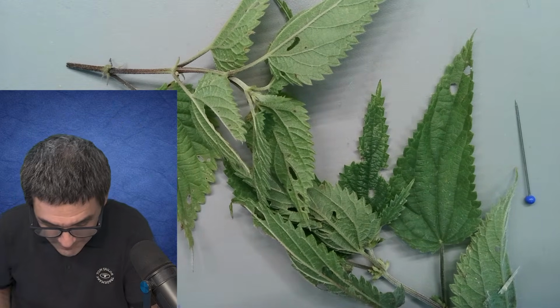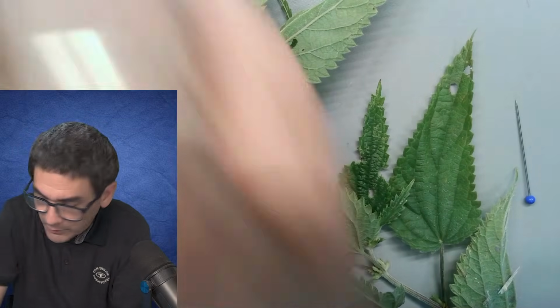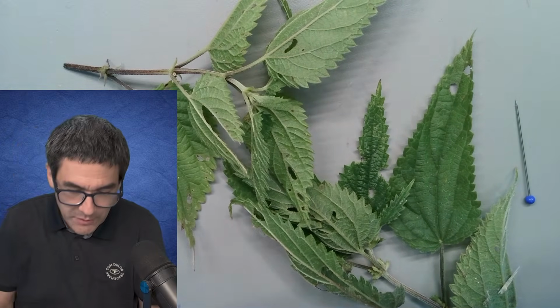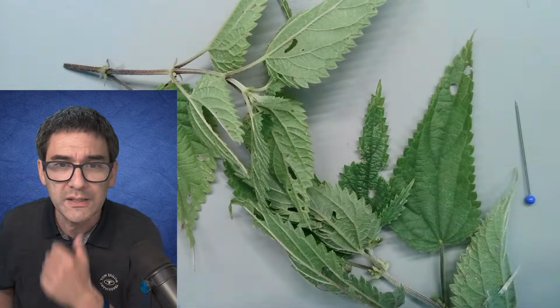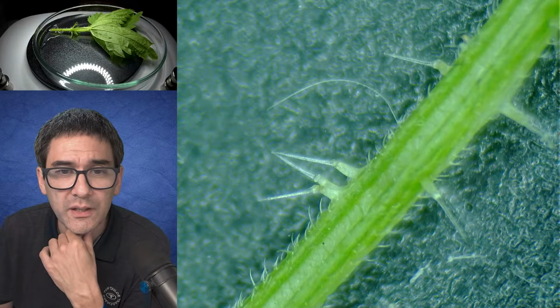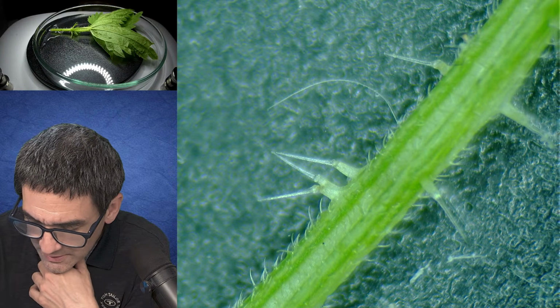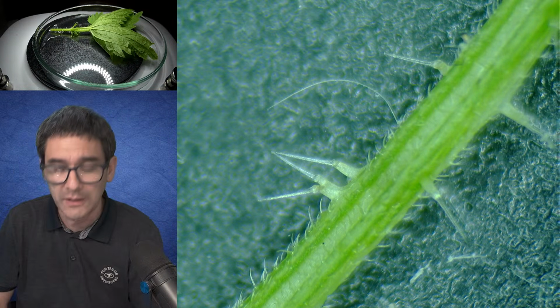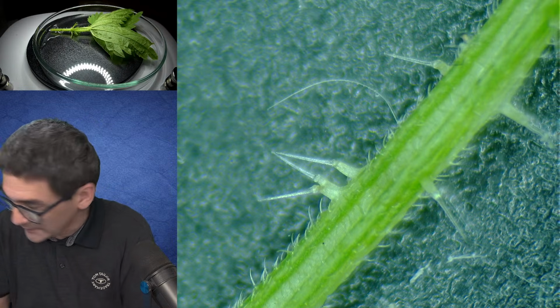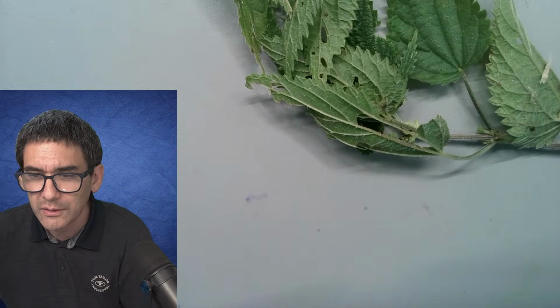You see, I need this here, and the microtome. But what I would like to do first, and that's going to be maybe the more difficult part, is to put some of those, where's this, those things here, under the microscope. So I somehow need to be able to cut this off carefully, and that's going to be a slight challenge. So I'm going to go back to the desk view.